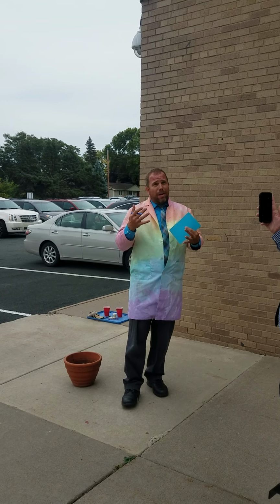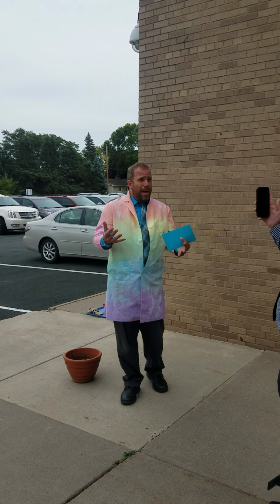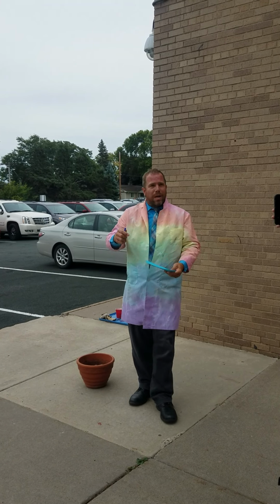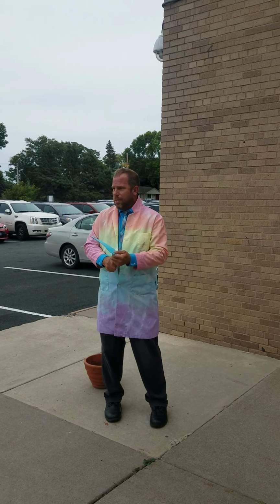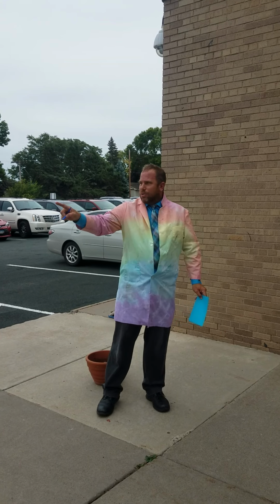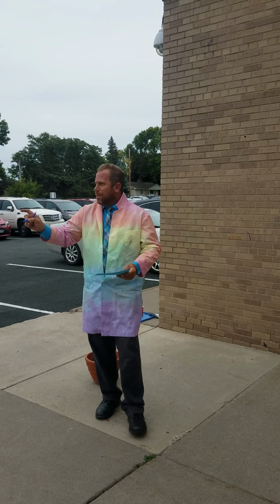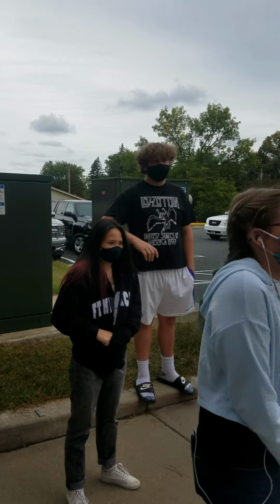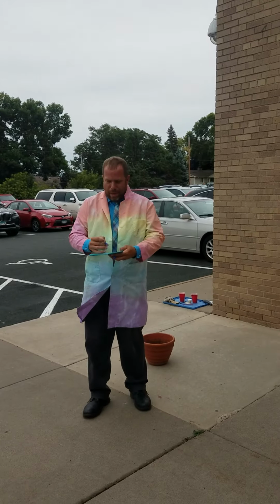And we thought we'd always start out the year with a bang. So I'm going to show you something today. We talked about this, we're going to do 2 chemicals today. And I've got a couple people here to help me. They're here just for learning purposes. Everyone wave.